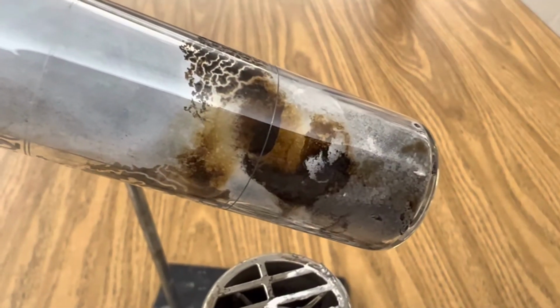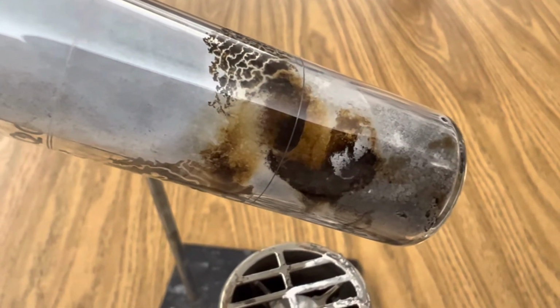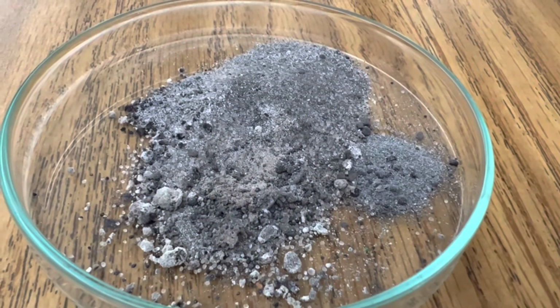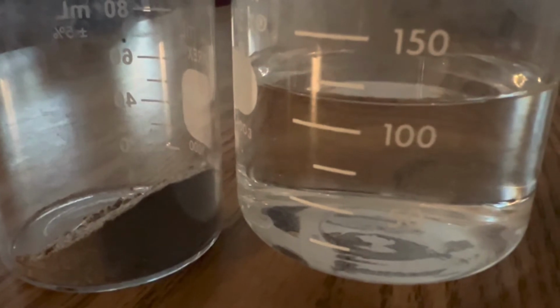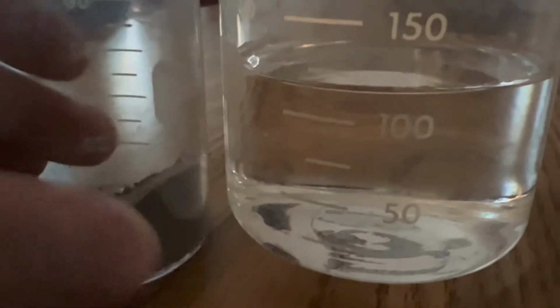So at this point, it's cooled down, and magnesium silicide was also formed during this reaction, and you want to scrape that out. After you've scraped out your magnesium silicide, add it to your beaker of hydrochloric acid to produce silane gas. Silane gas is pyrophoric because when it mixes with oxygen in the air, it can spontaneously combust at room temperature. Okay, for this next step, I'm using 12 molar hydrochloric acid, and I'm going to add our magnesium silicide that we made to see if it'll generate some silane gas that is pyrophoric.